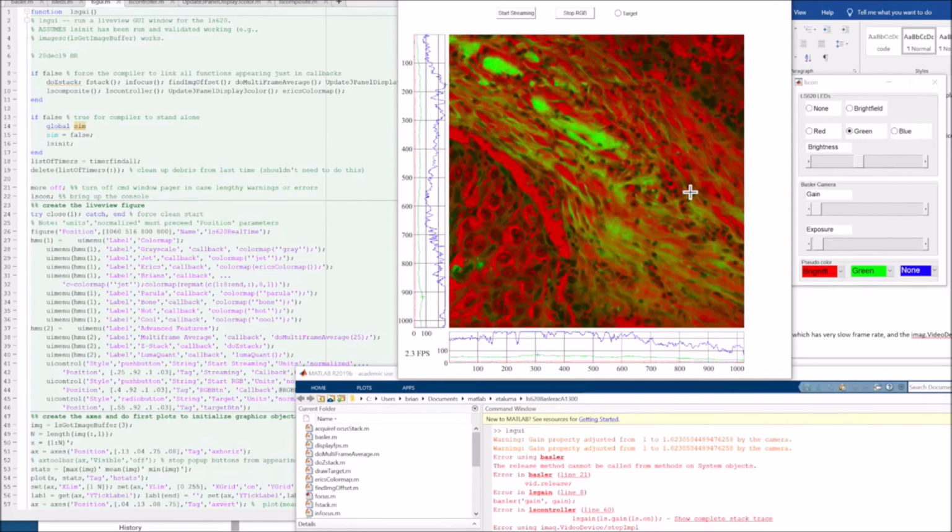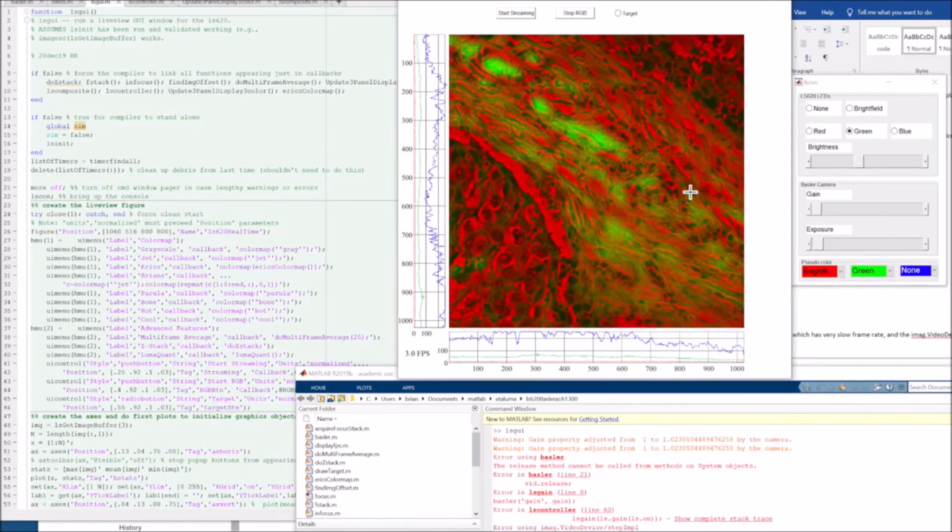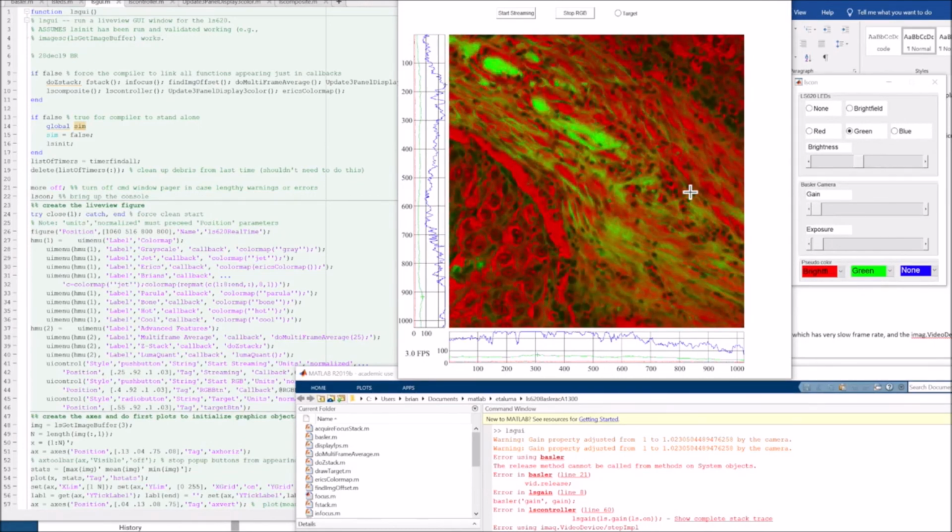but it's sort of cool again to be able to zoom in, play with the focus a bit. And this is running at 3 frames a second. Here's what it looks like from the top.